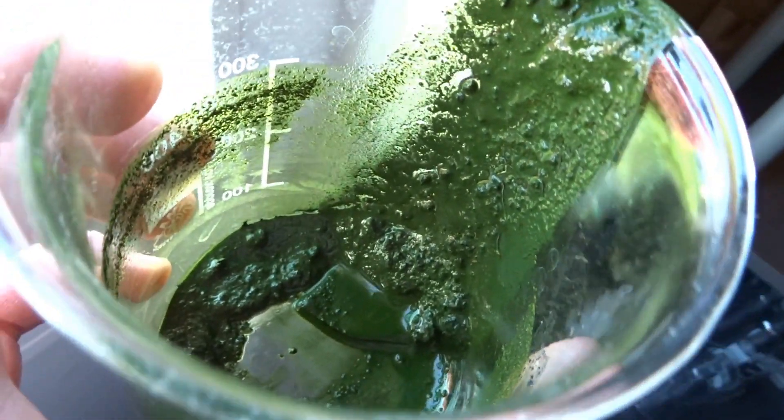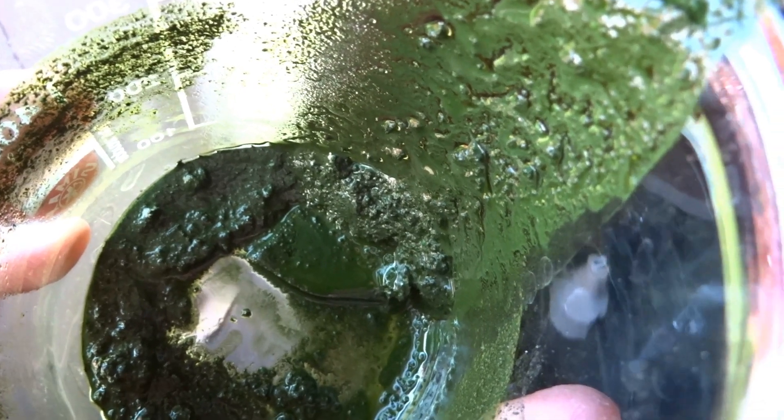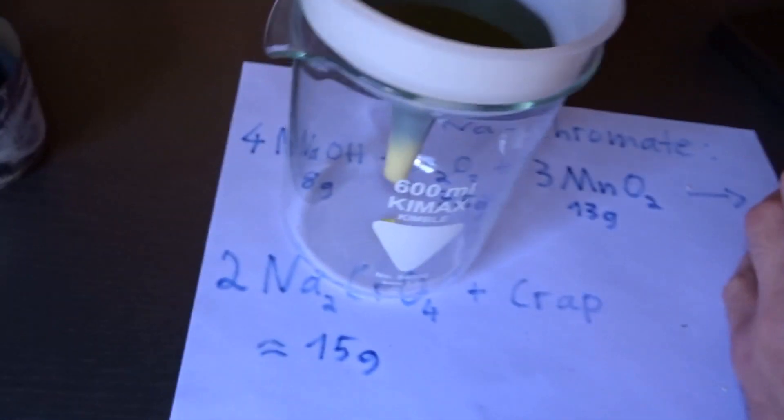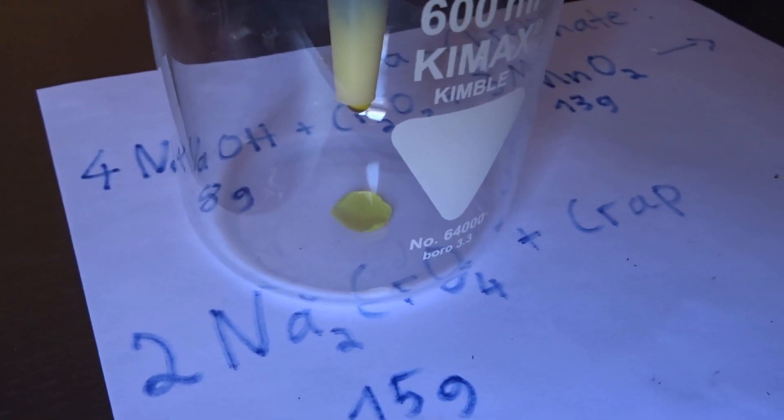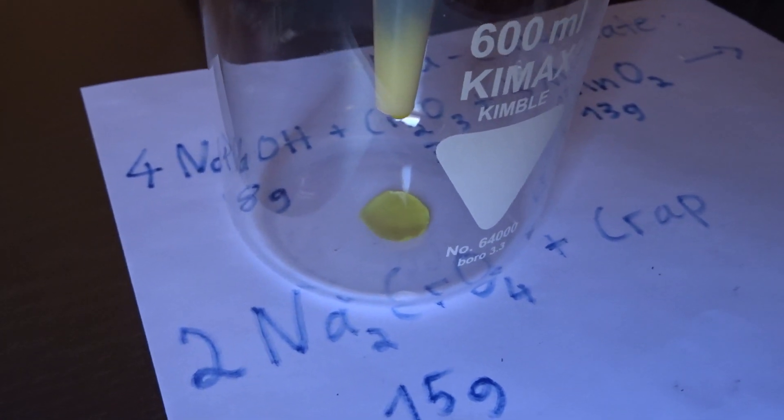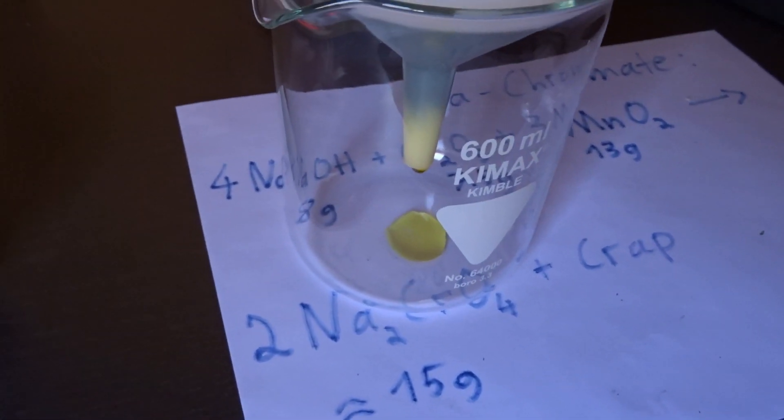The slurry here probably gets a second run. So you see by far not all has reacted, but a nice amount I hope so. And you see yellow. That's a success. That means there's chromate in this junk here. So this allows you to filter. And later I'll take a closer look at the chromate.